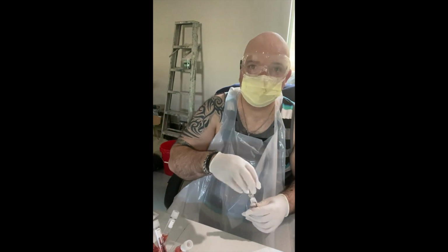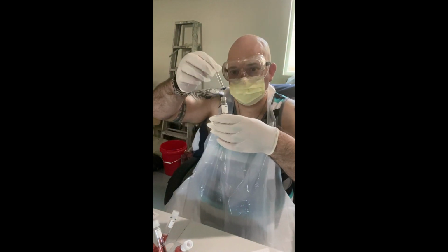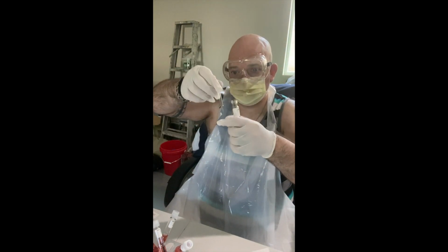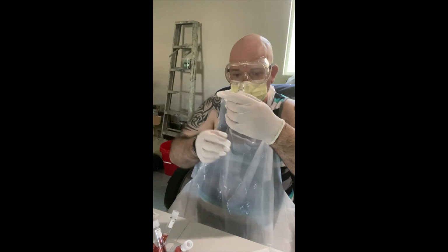Now at this point, the numbers of the tubes don't matter since I'm not adding anything into the tubes, just the tubes themselves. 2.